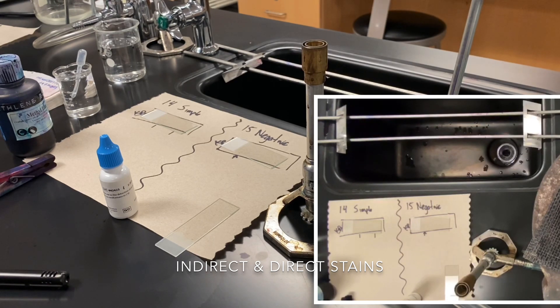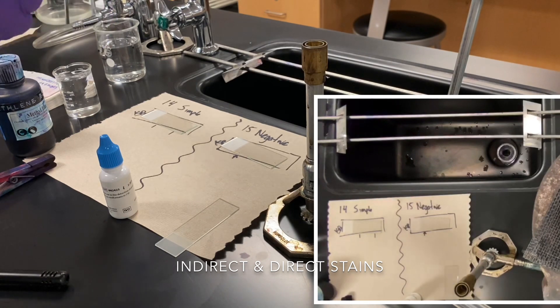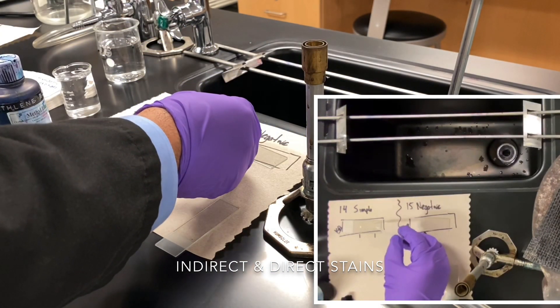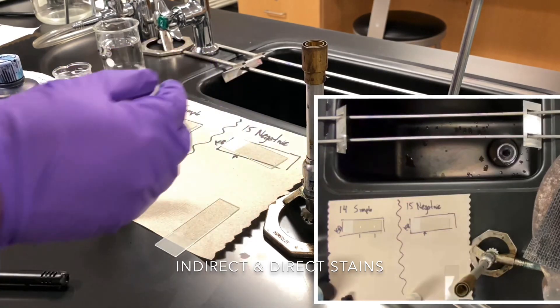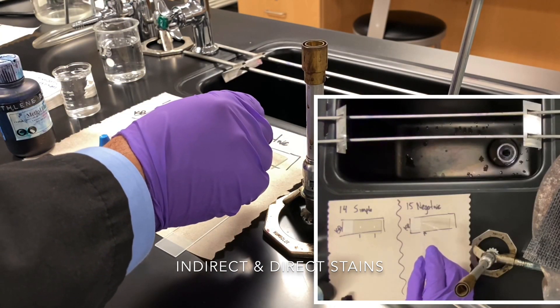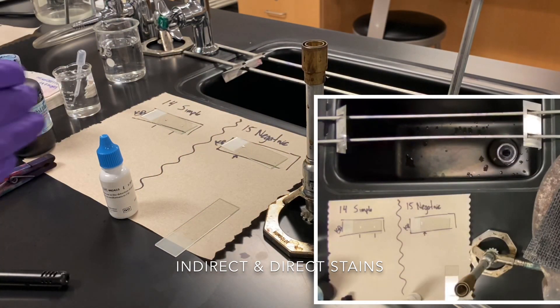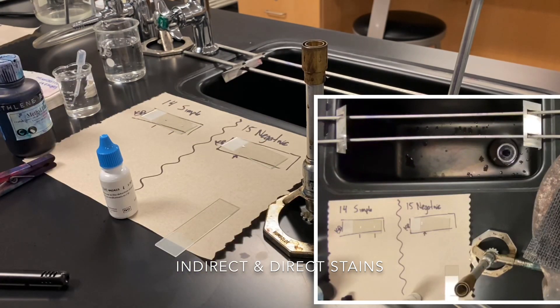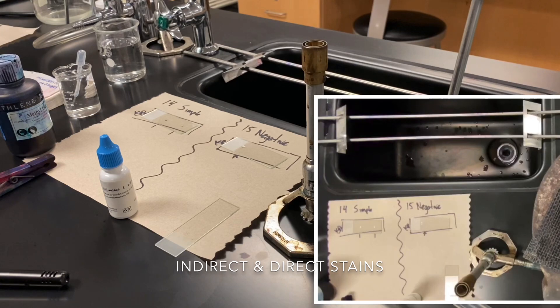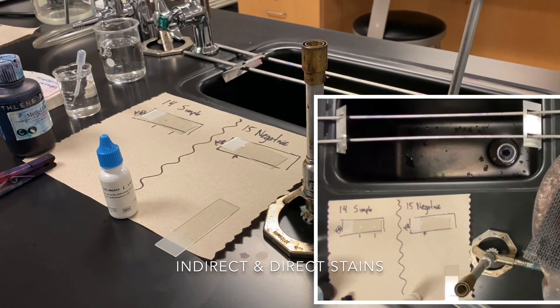We want to always prepare our smears, and both of these require some air drying. I'm going to set up tiny drops for our smears as we've done before. For the negative stain, I'll create a slightly larger drop right at the edge of where the frosting ends and the rest of the slide begins. We still want to transfer organisms aseptically, so I'm going to set up the Bunsen burner.